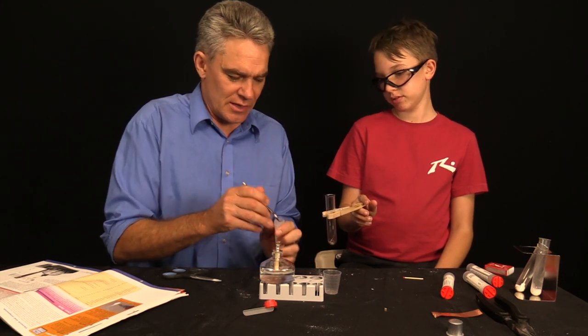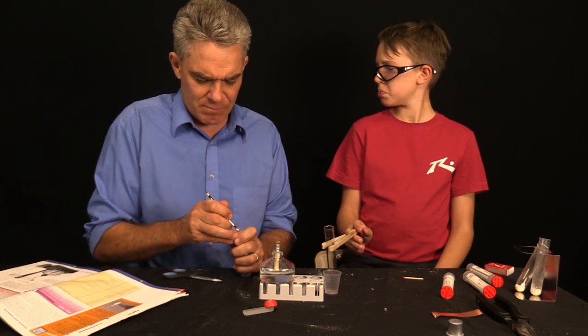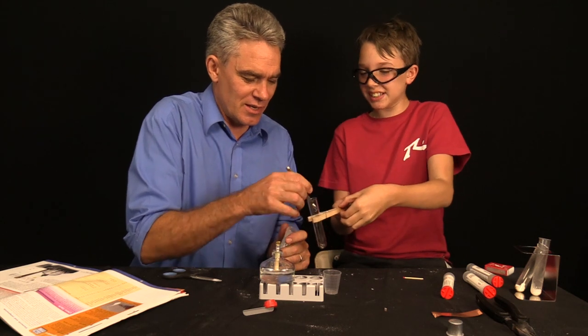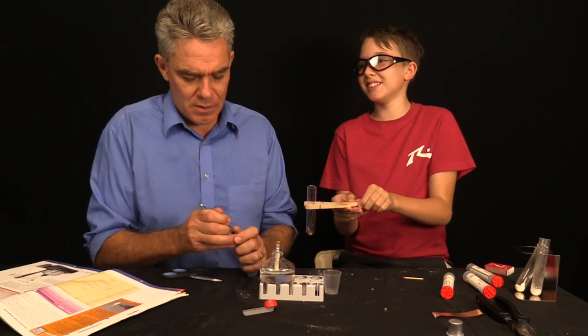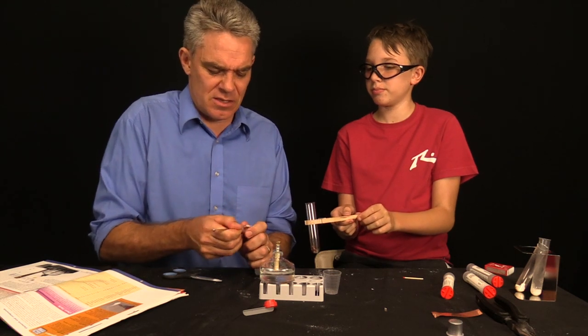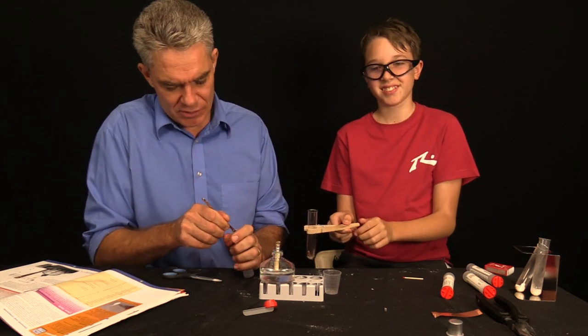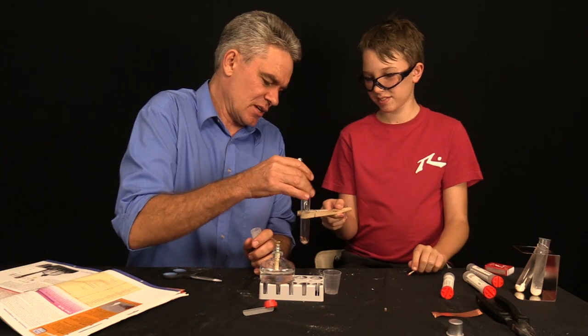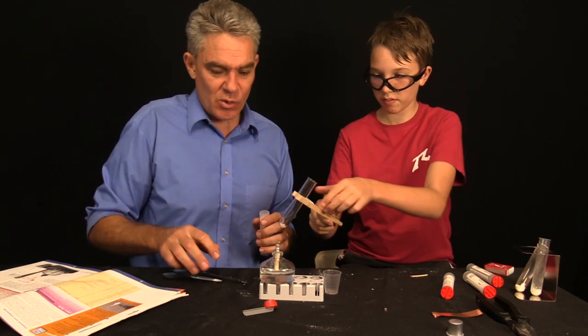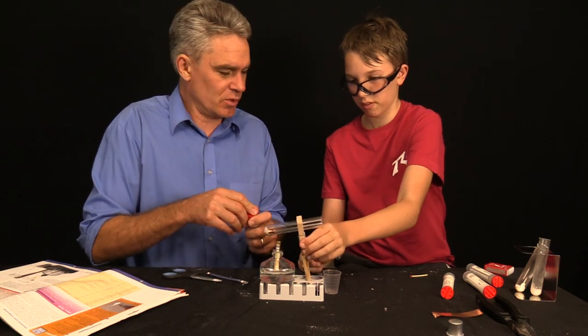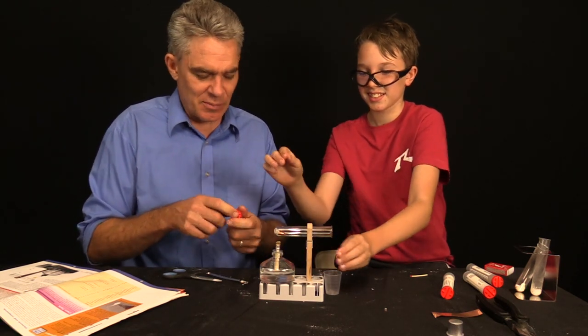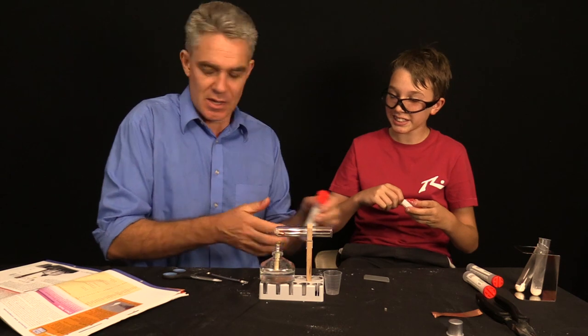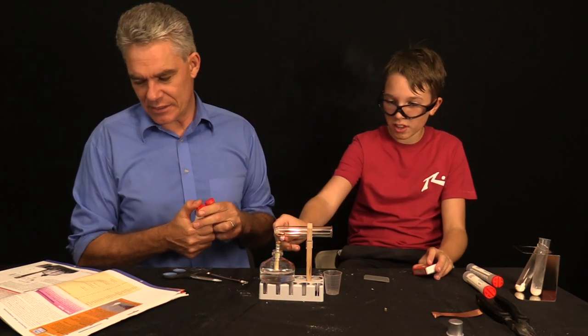We're going to put in two spoonfuls of sodium hydrogen sulfate. Sodium hydrogen sulfate, which is this one. And I'll get the little opener. It's a white crystalline. It looks like sugar, but you don't want to eat it. It looks a little bit like ice amphetamine, to be honest. Like the drug. Not that I would know. I've seen it on border patrol. Ice is a terrible drug. Terrible blight on society. Makes people very agitated and violent. Stay well away from drugs. Sam, will you stay away from drugs? Yes. Good. He sees what happens to people on Border Patrol.